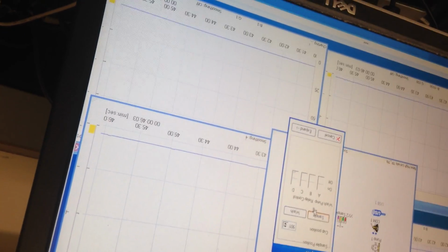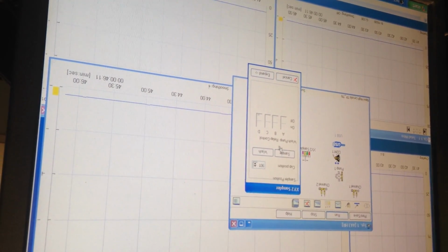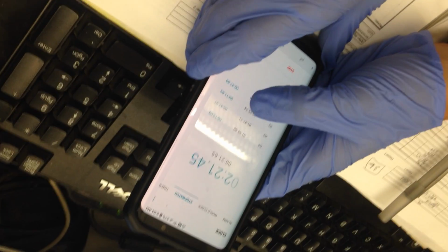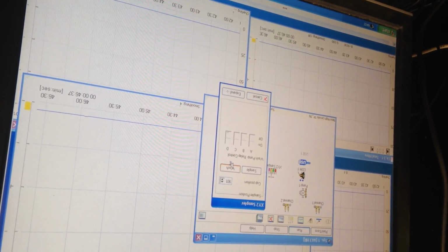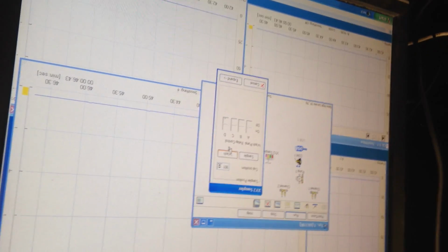Yeah. Then 2 times sample. One time only, yes. And you can see the splits. 47 second sample, 12-second wash, 47 second sample, 12-second wash, and then your last 48-second sample. So I thought it should be 3 minutes, right? Yeah, should be about 3 minutes.